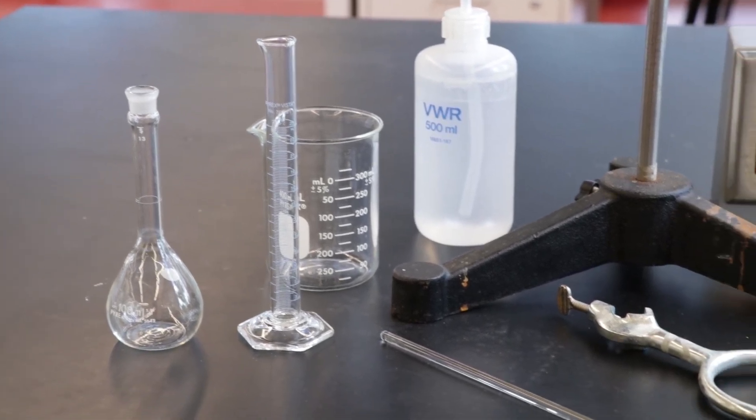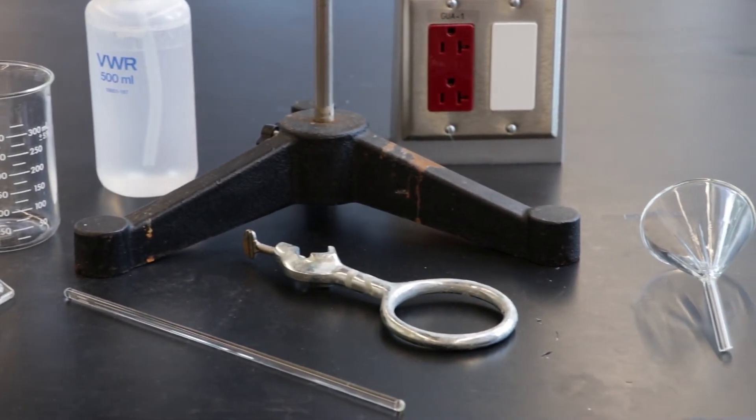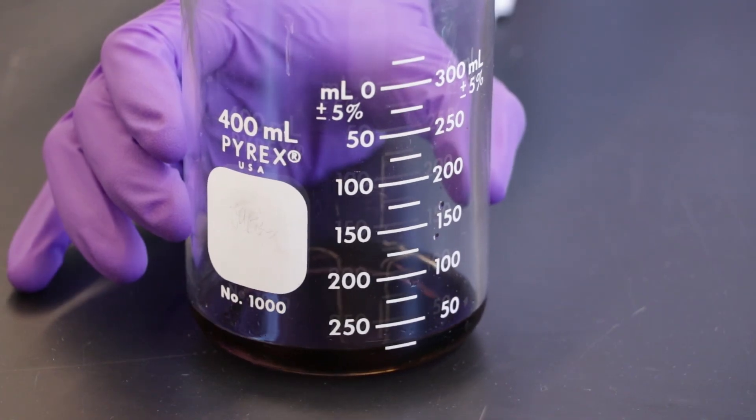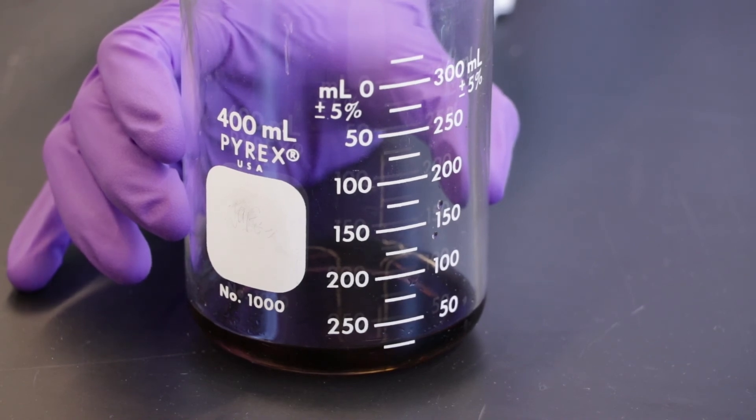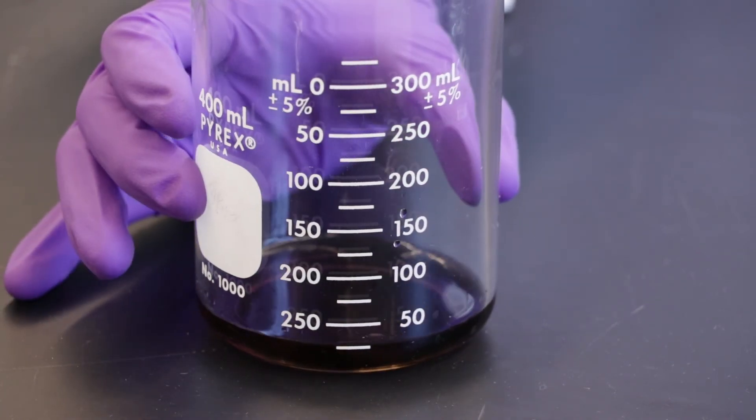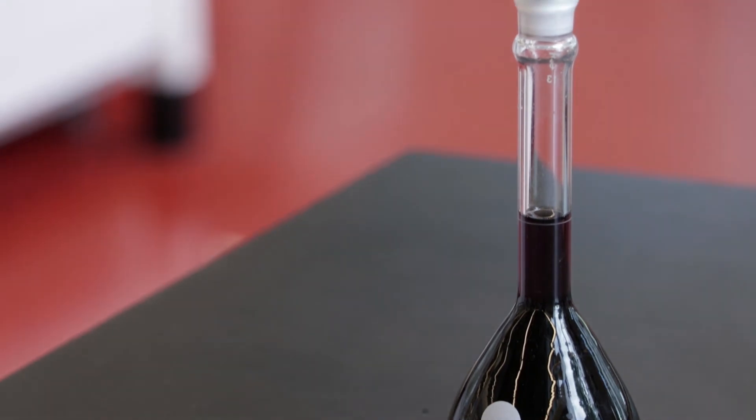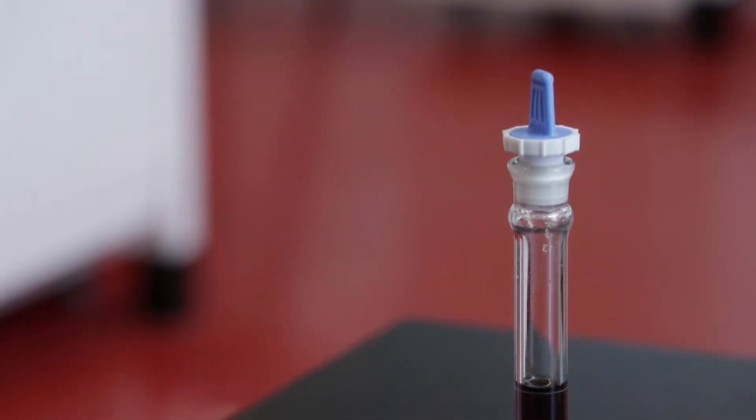In this video we will be demonstrating how to perform a quantitative transfer of a solution of Kool-Aid. A quantitative transfer is used to transfer the entirety of a solution from one vessel to another without losing any analyte in the process.